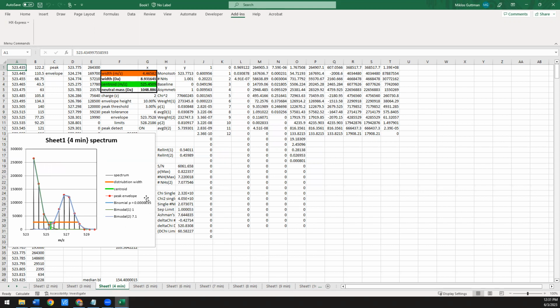There's also this p-value that you see popping up in the total binomial fit. This is from an f-test that's used to determine the significance of whether you can justify using 2 binomials versus 1. And in this case, the p-value is way less than 0.05. So you have high confidence that yes, you can easily statistically justify fitting to 2 populations instead of just 1. So the lower the p-value, the better. Anything above about 0.01 or 0.02, I would think definitely needs to be looked at more closely.